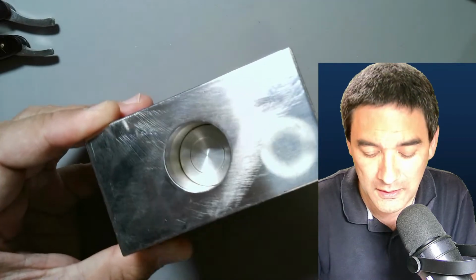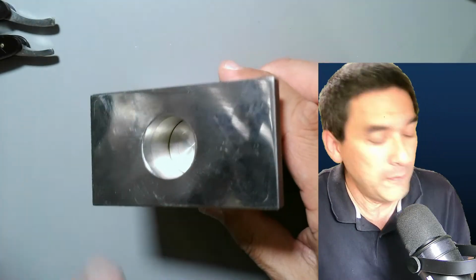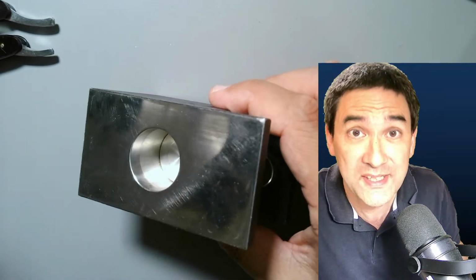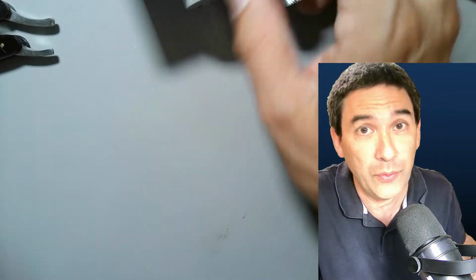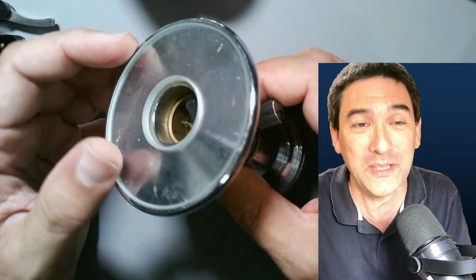So there's some slight scratches on here, but that's perfectly fine. I want to show you, first of all, my 2 other microtomes that I've been using, and the advantages and disadvantages. So this one, and some of you already know them because you've been watching the videos and live streams before. That's the one that I've also been using.